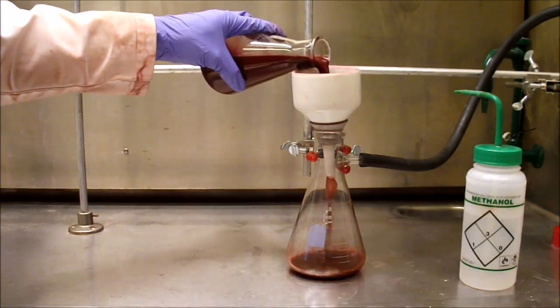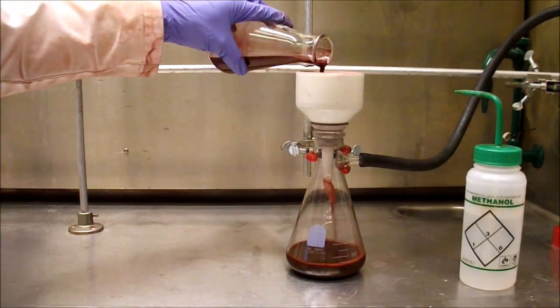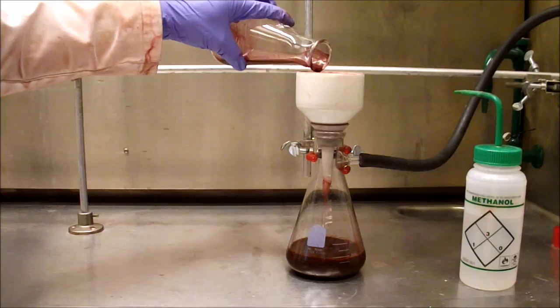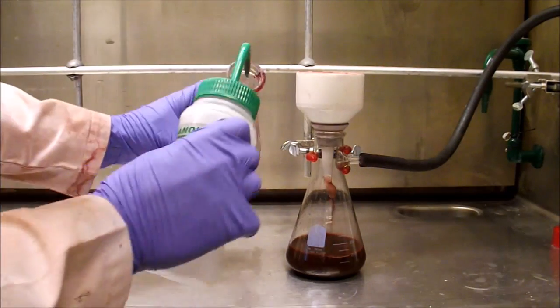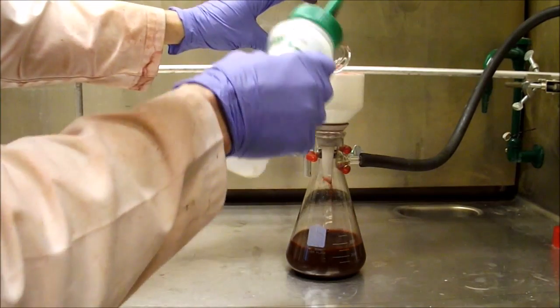Since both imidazole and ethylpropyl amine are highly soluble in methanol, this method ensures that what we isolate from this filtration is pure ethylpropyl PDI. The filtrate of this solution is a dark red color which does indicate the presence of ethylpropyl PDI.